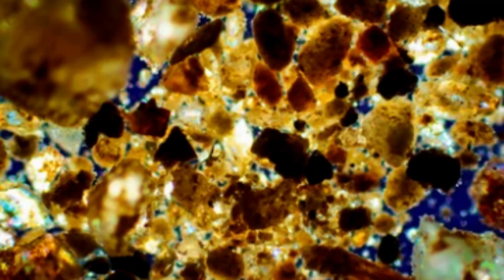When a thin section is examined under a polarizing microscope, the microscope uses polarized light to reveal the properties of the minerals present in the rock. Polarized light is light in which the vibrations occur in a single plane, which allows it to interact with the mineral structures in a unique way. As the light passes through the mineral structures, it can reveal key properties such as the mineral's optical properties, birefringence, and pleochroism.